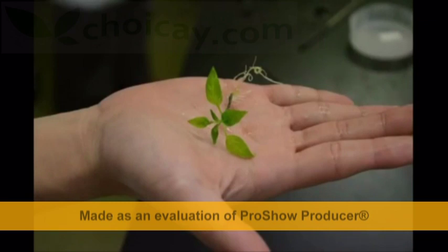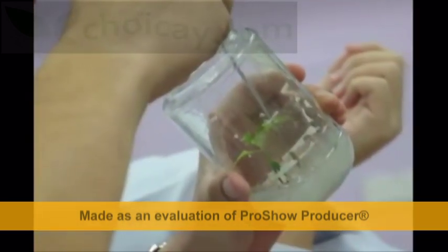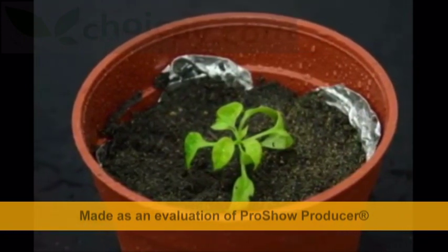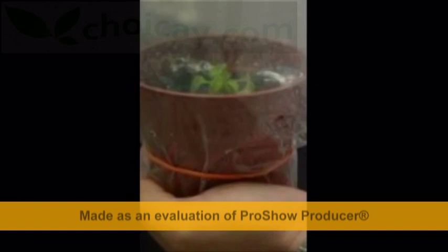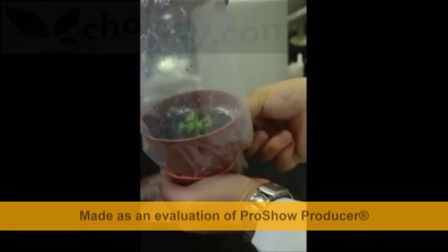The hardening process is required to transfer the in vitro plantlet to the ex vitro environment. With successful hardening, the establishment of the plant enables plantlets to grow at a fast rate. The plantlets undergo an acclimatization and adaptation period to mimic the in vitro culture environment, such as covering the plant in a transparent plastic bag to retain humidity and airflow, and placing it in a shaded environment for low radiance and to avoid direct sunlight.